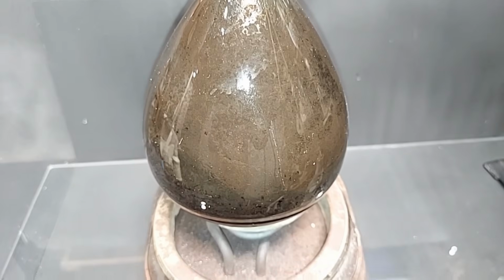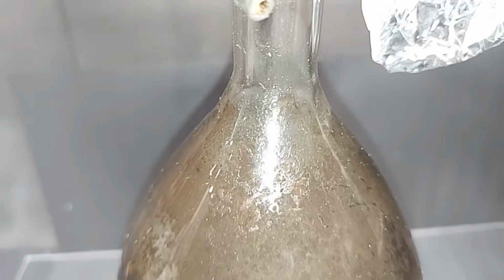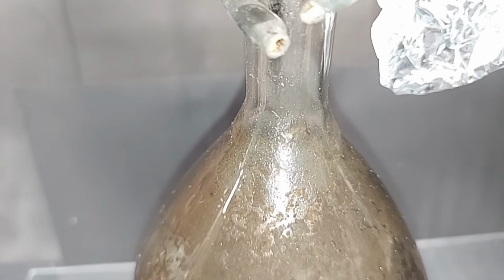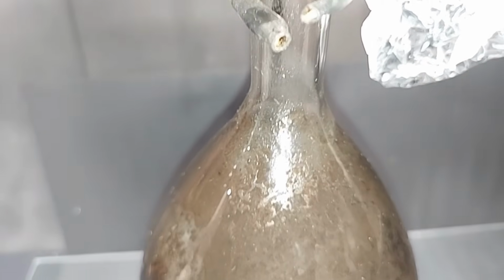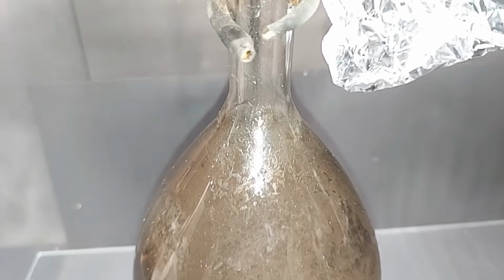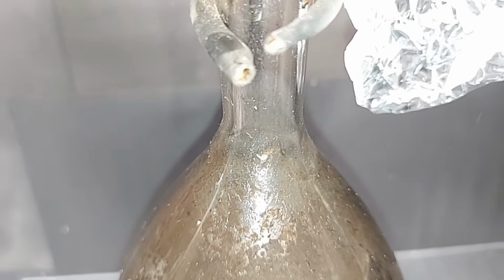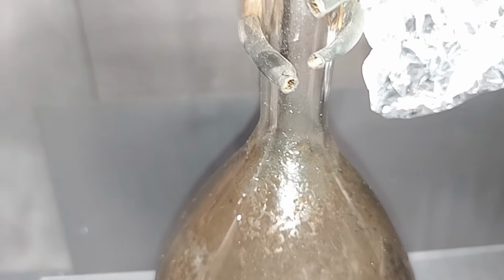On this end, because everything stopped dripping over, I turned it off, of course. It's still pretty warm and you can barely see that sulfur trioxide gas still kind of gurgling through the top right there. Of course, as it cools down, that will dissipate completely, and that's when I'll take this apart. You can also see that this bubbled up right to the neck there. So I'm grateful I only used half of what I had, because this ended up turning out really, really well.